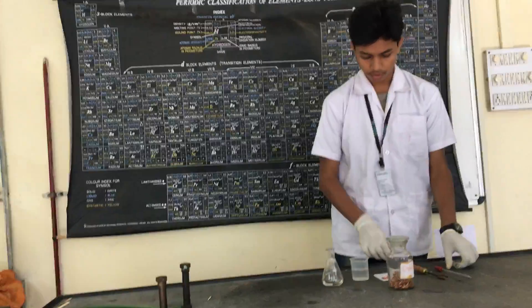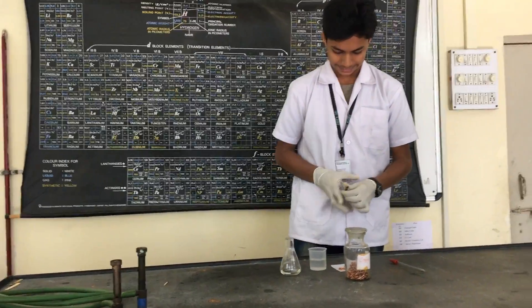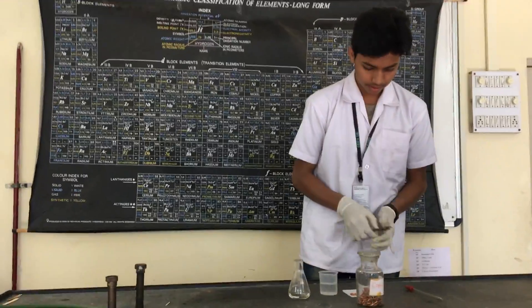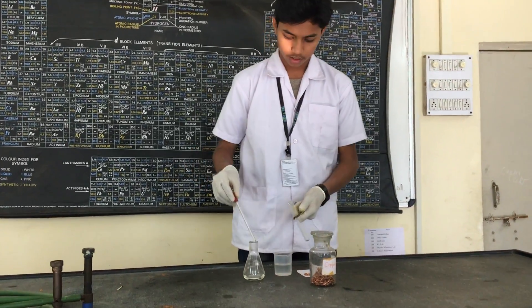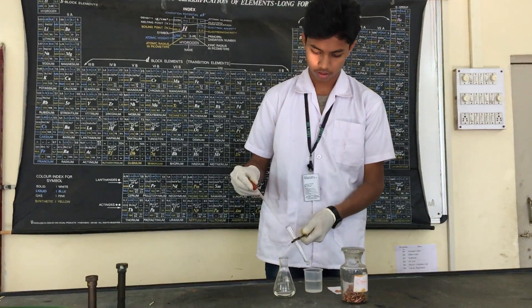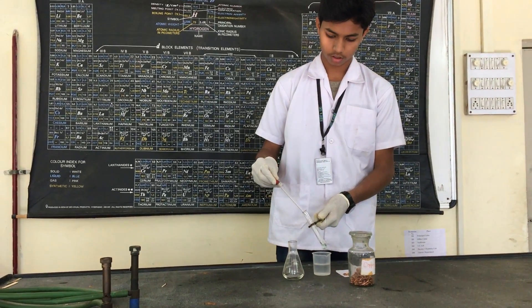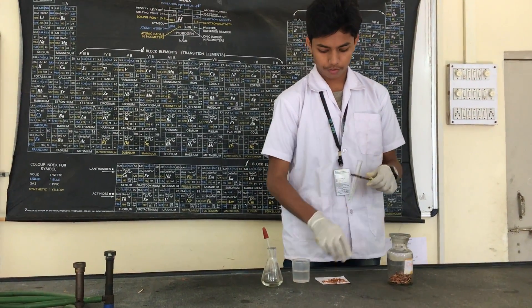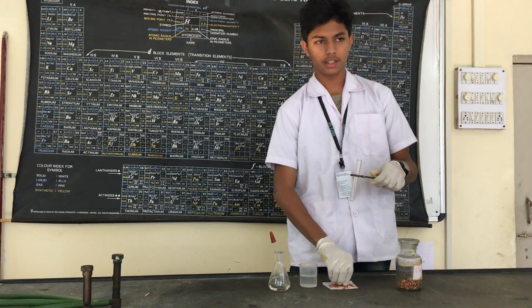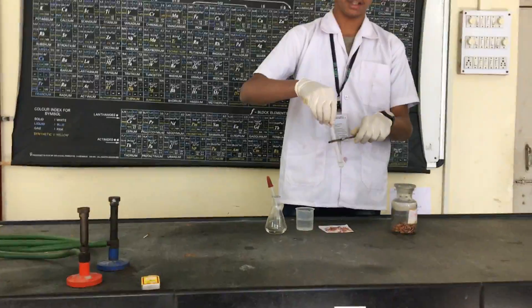First we will add some amount of HNO3, that is nitric acid, into the test tube. Now when we add copper into the nitric acid, there forms copper nitrate which turns the solution green.